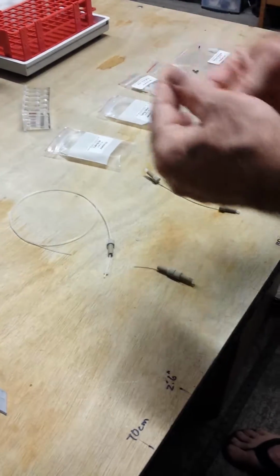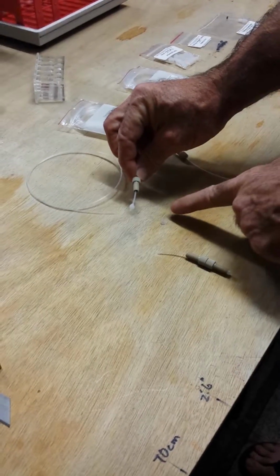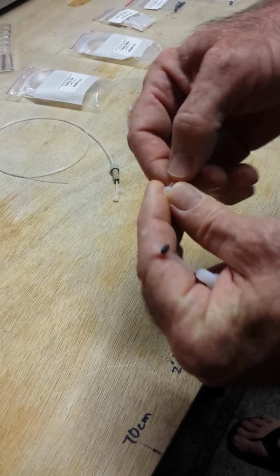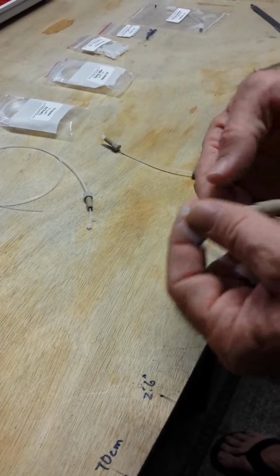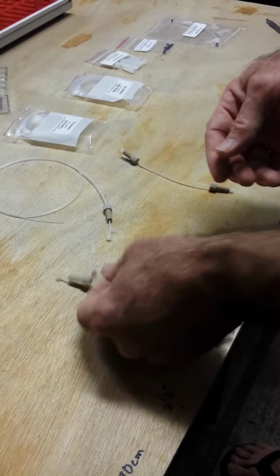And don't forget that these nuts and ferrules are single use because they're designed to seal by tightening down every time. And once they're tightened down, then they can never really be tightened again. You see how tight that is. So they're expensive. They're several dollars each, and this fitting is not cheap either.